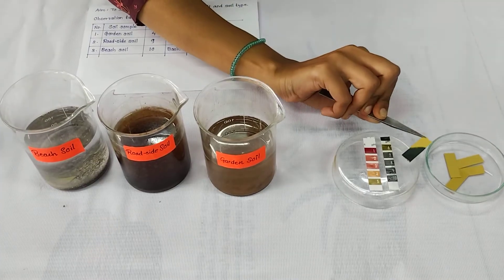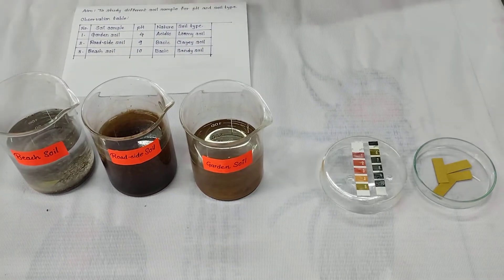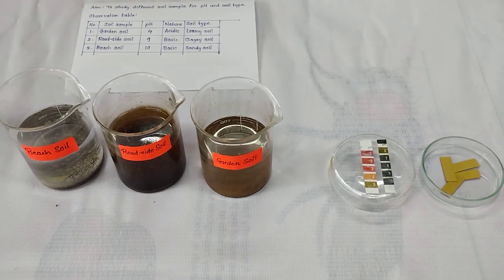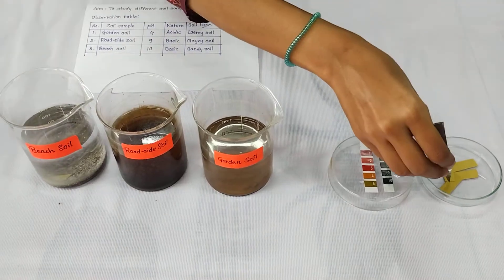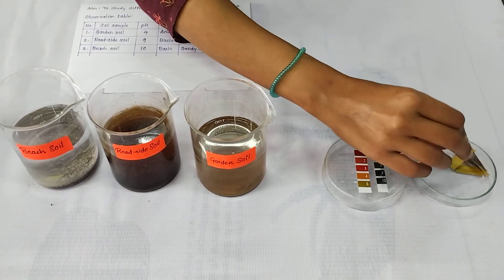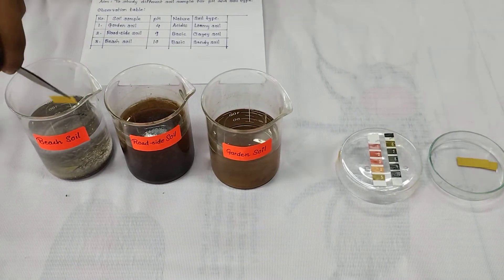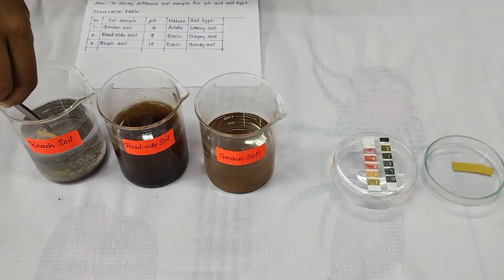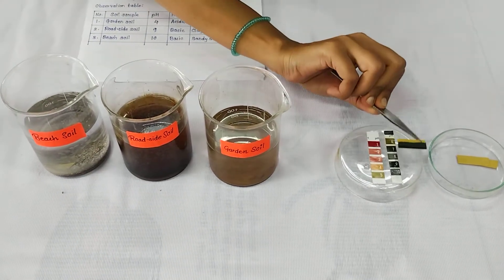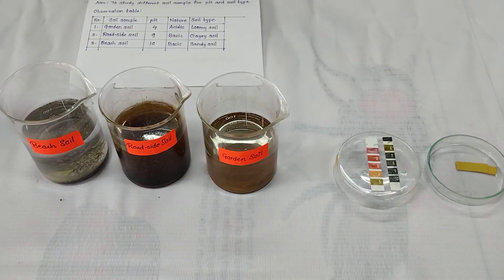Now secondly, we are going to take the pH of roadside soil. It is 9, so hence it is basic in nature. Next sample is beach soil. Again, we are going to take a pH paper and dip it in the beach soil sample. Again, colour change, and the pH is 10.